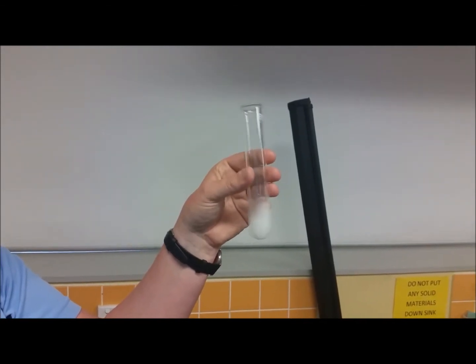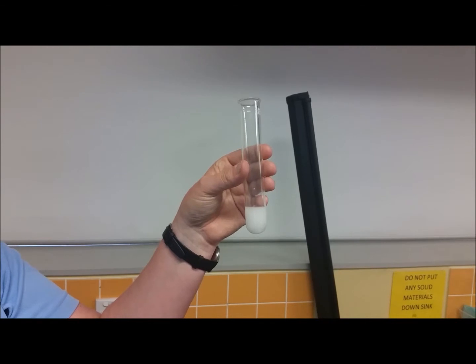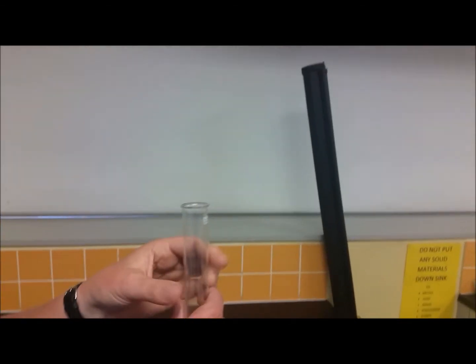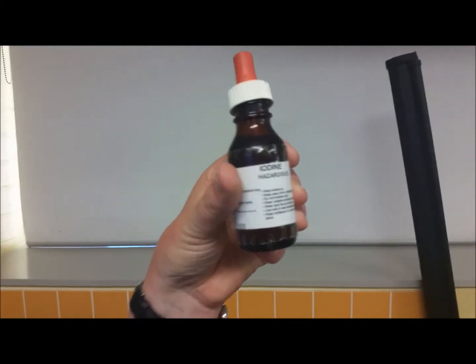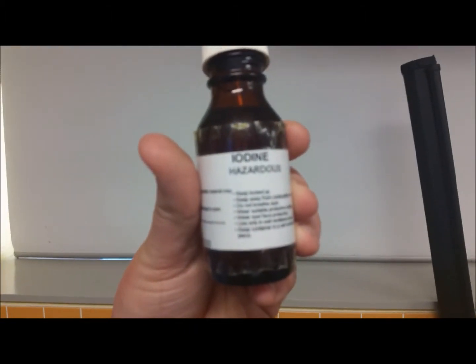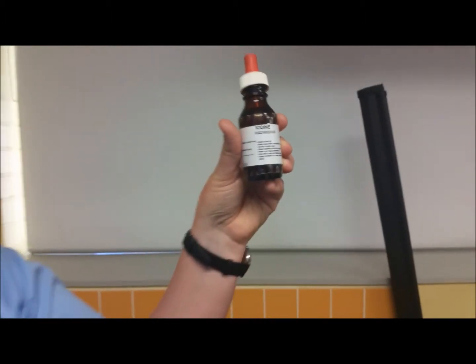So the test for starch is very quick and easy. It requires a reagent and that reagent is iodine, which is all available in these dropper bottles.